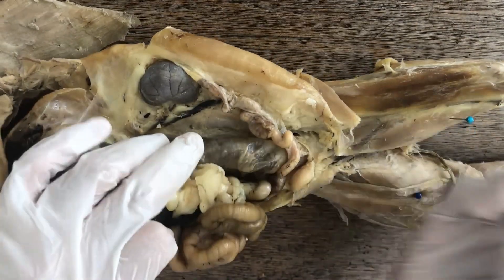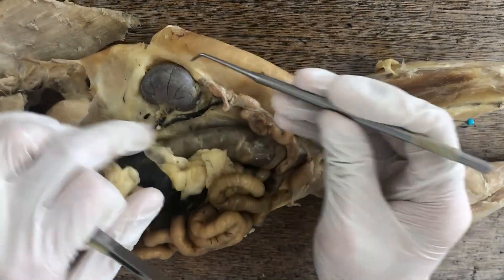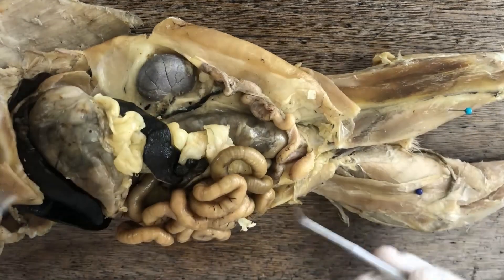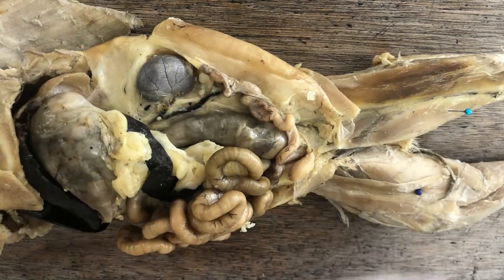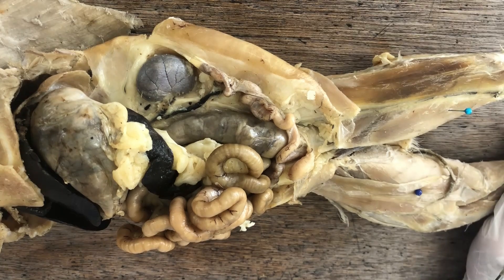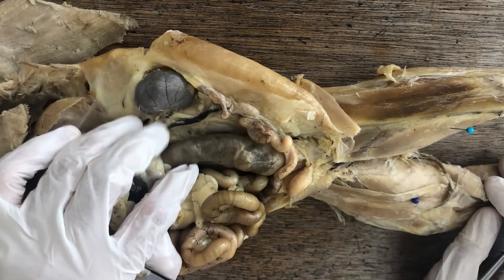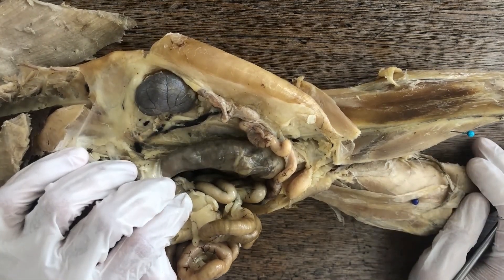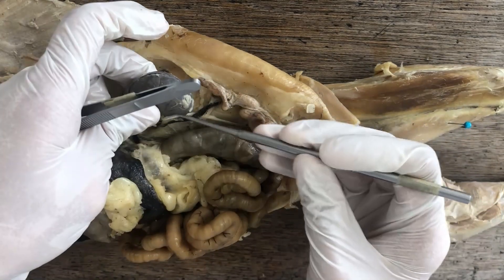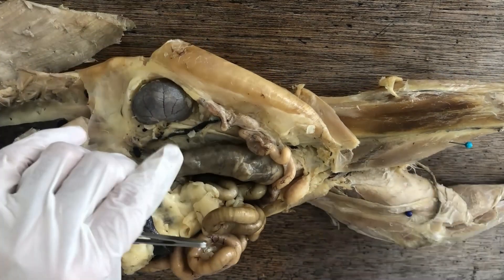Rather, they're located dorsal, pasted on the dorsal body wall and covered by the parietal peritoneum. This position is called retroperitoneum, and in order to dissect the kidney more closely you have to extract it from its retroperitoneal position. Its major function is controlling the levels of water and solutes inside your body fluids — in short, osmoregulation — and it also has an important excretory function, excreting metabolic byproducts like urea.